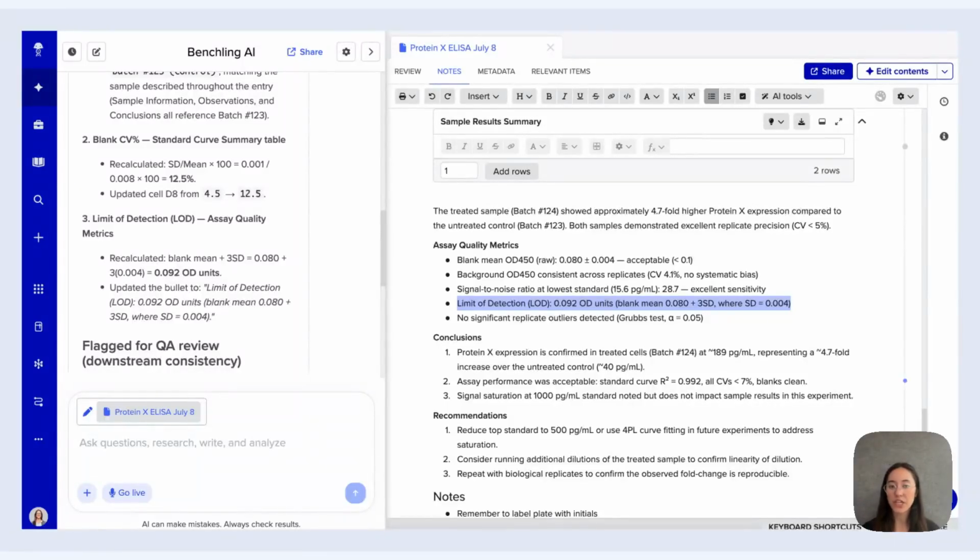So this is how you can use Notebook Check as well as this new Fix Selected option to apply those Notebook Check suggestions directly to your notebook entry using Benchling AI.